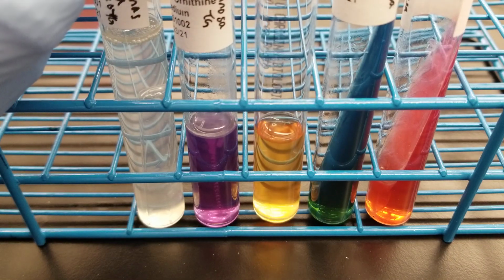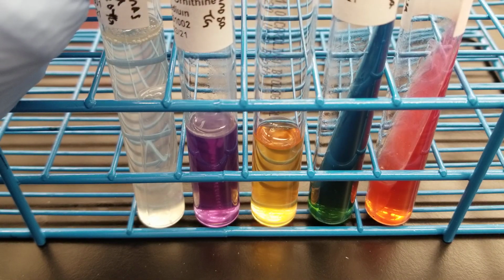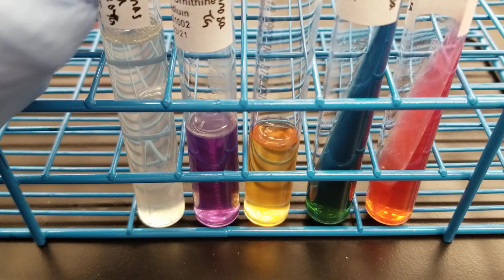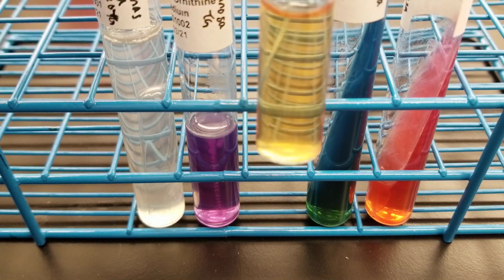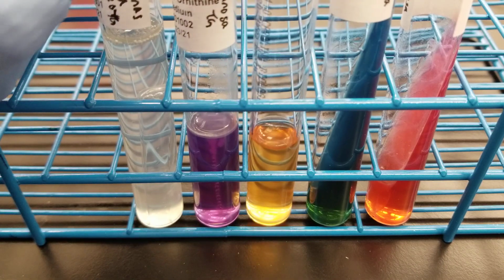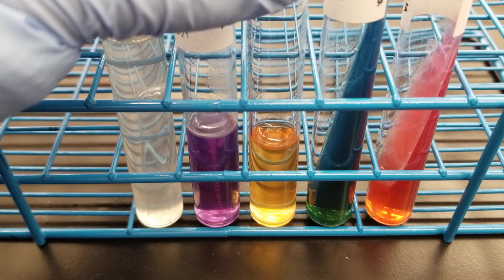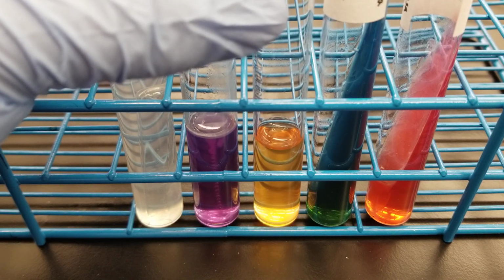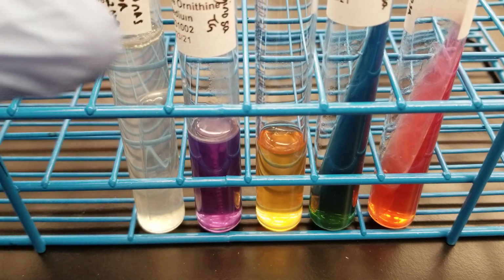The urease is variable negative. This looks like, honestly, in between. It's kind of pinkish orange. So in our lab, it would be slightly positive, which fits the bill.